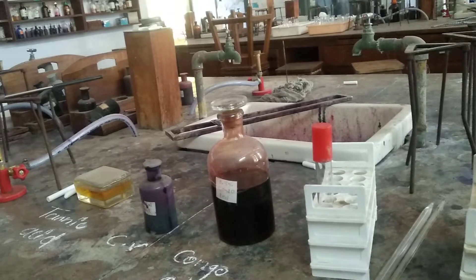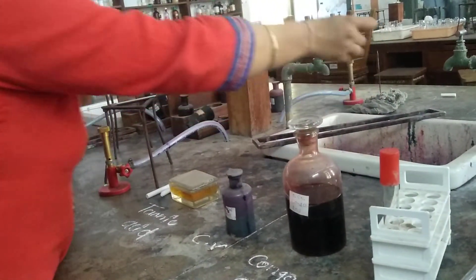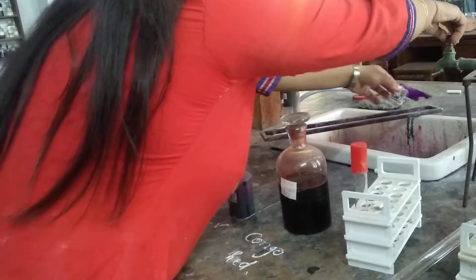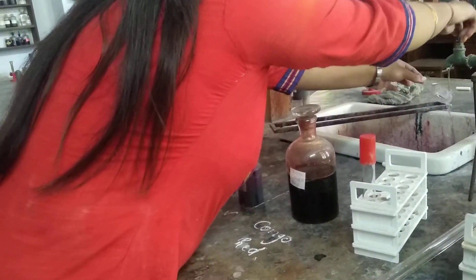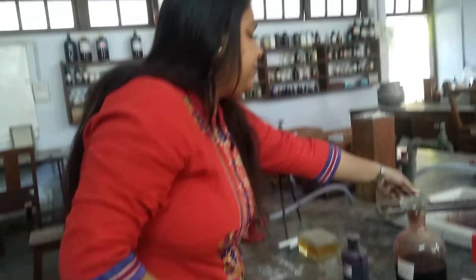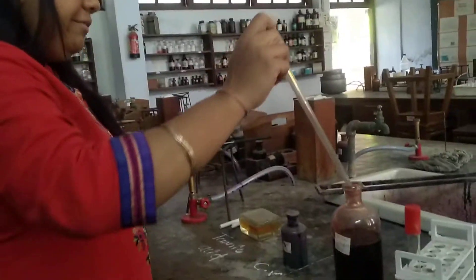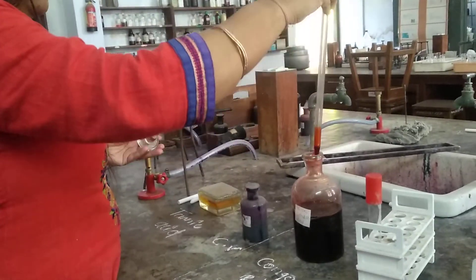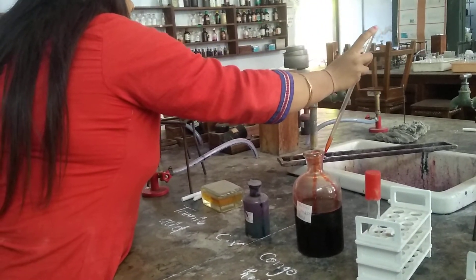Now, 2 minutes have already passed. We will take this slide and give it a gentle wash. After giving a gentle wash, we will keep this slide again on the slide rack. Now we are going to add Congo red, which is at 0.5% concentration. We will again flood this slide with the Congo red for 2-3 minutes.